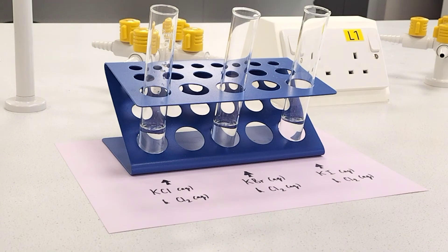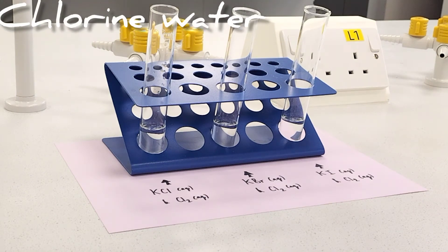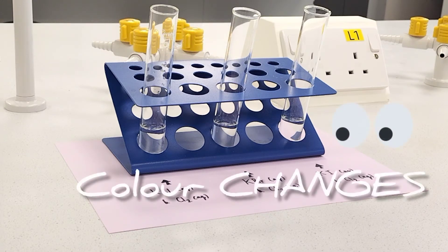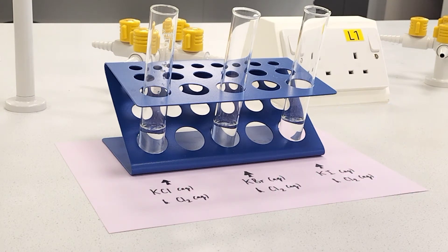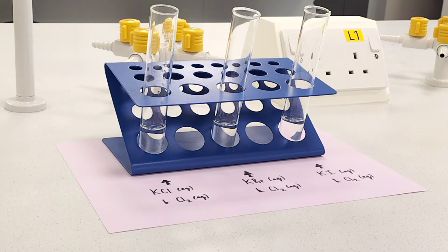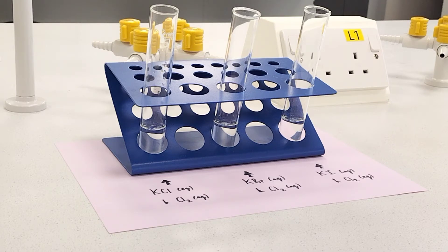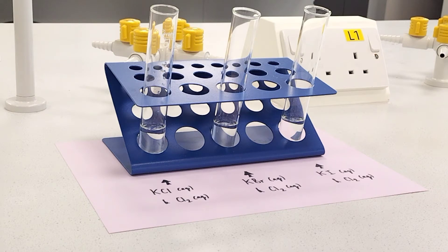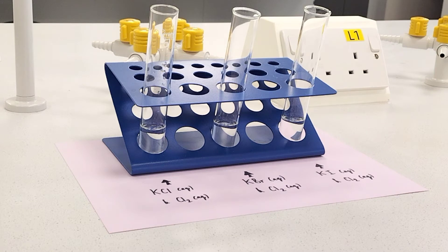To each of those boiling tubes I'm going to add some aqueous chlorine water, which is chlorine dissolved in water — dilute chlorine. I'm looking for any observations of colour changes which are indicative of a displacement reaction taking place, which might help me to discover how reactive chlorine is. I'll bung them so that the fumes of chlorine don't escape, as it's not a particularly nice smell.